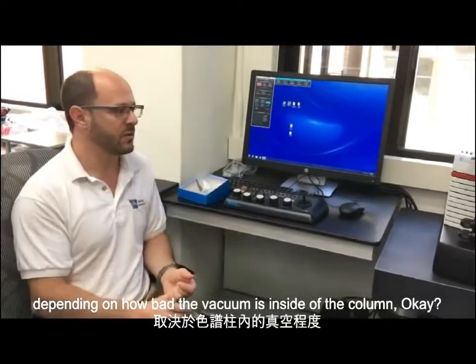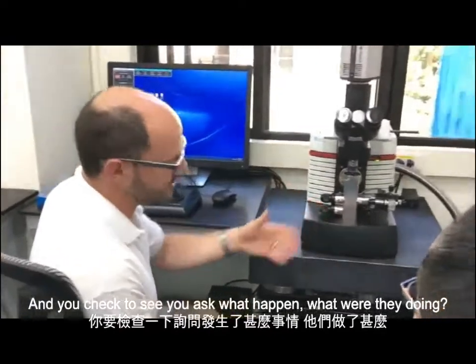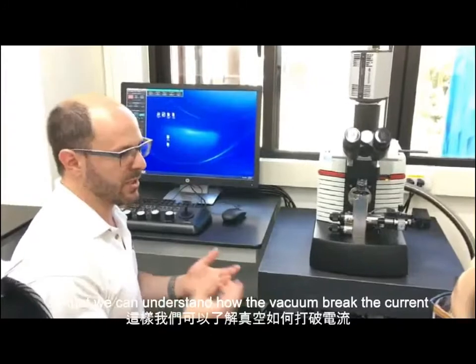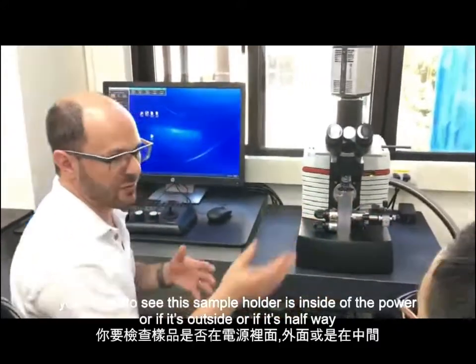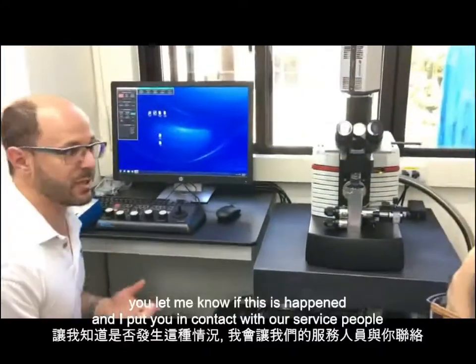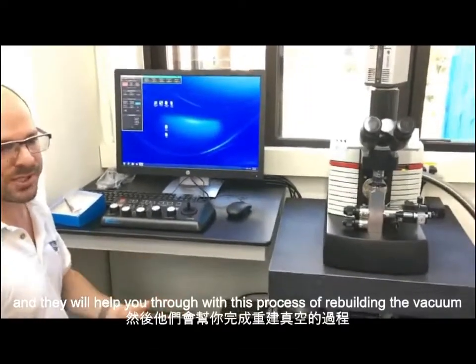Okay? So Jonas, you'll come and look, you'll see the ion pump has been turned off, and you'll ask what happened, what were they doing, were they loading the sample? That's usually the case, or were they doing something else, so that we can understand how the vacuum break occurred. You'll check to see if the sample holder is inside the column, or outside, or halfway, or somewhere in between. And then you'll send me an email. Okay? You'll let me know that this happened, and I'll put you in contact with our service people, and they will help you through this process of rebuilding the vacuum.